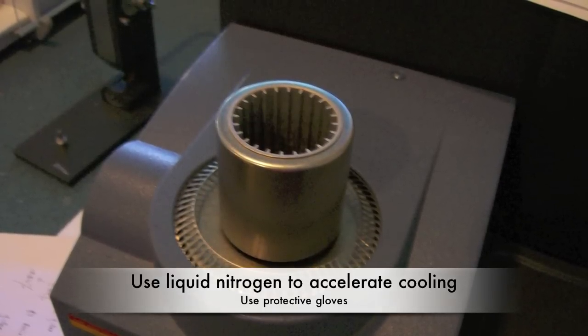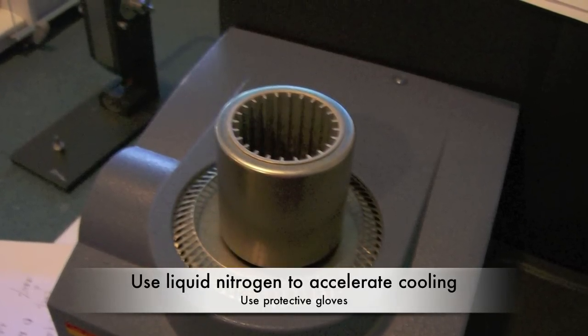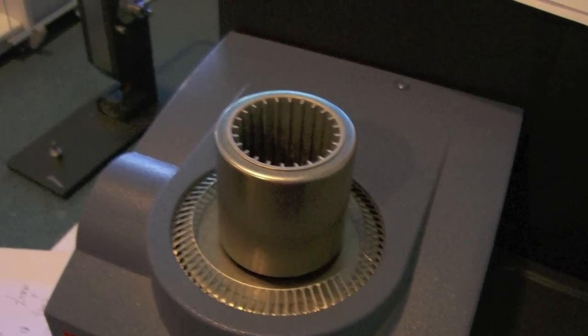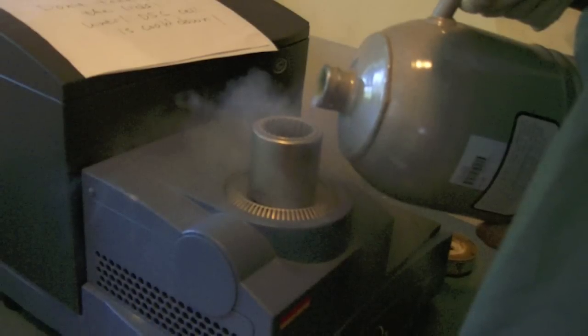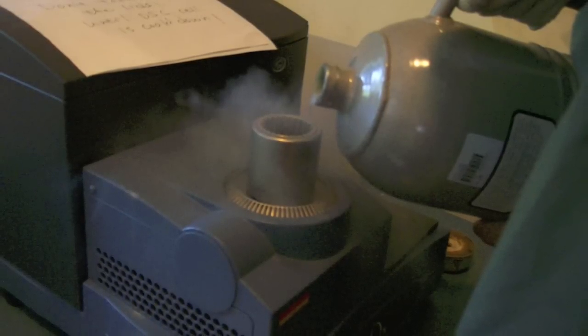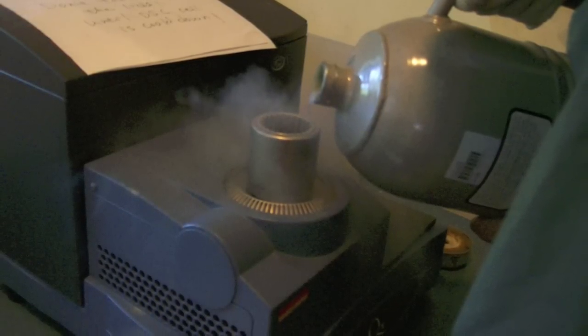Pour liquid nitrogen into the liquid nitrogen accessory. Make sure to use gloves when handling the liquid nitrogen. If you need to get the instrument down to subroom temperatures, start the run and then add the liquid nitrogen until your desired temperature is reached.